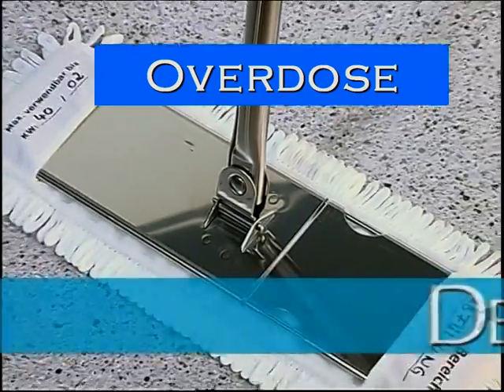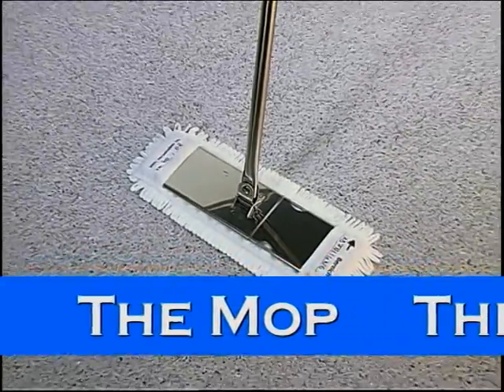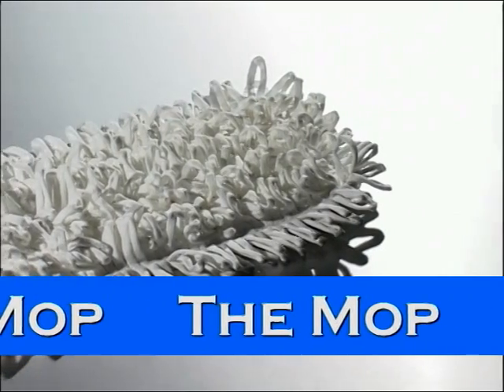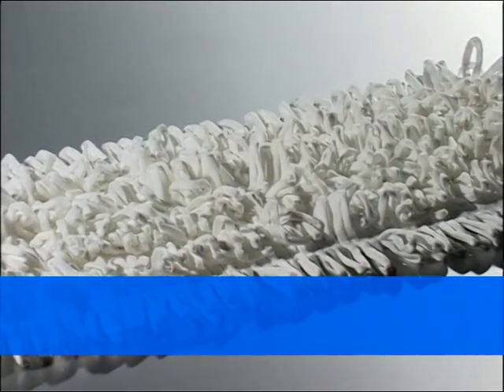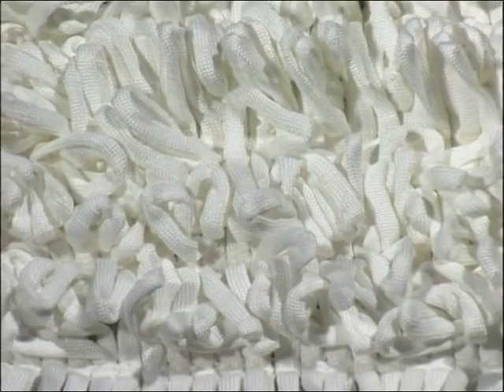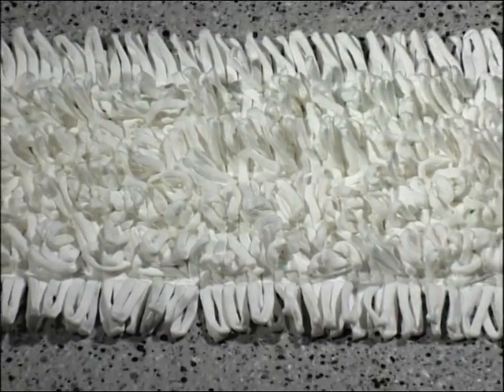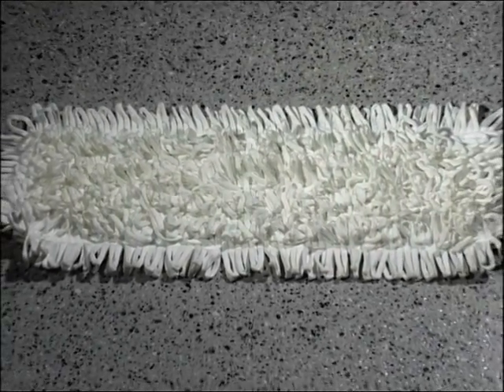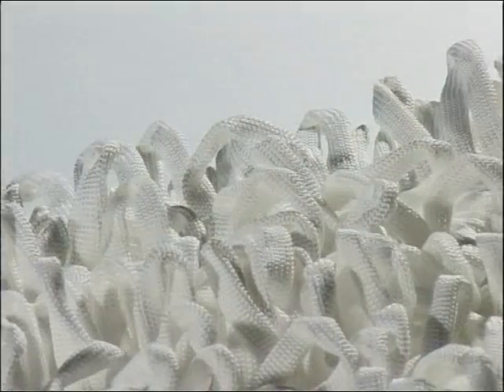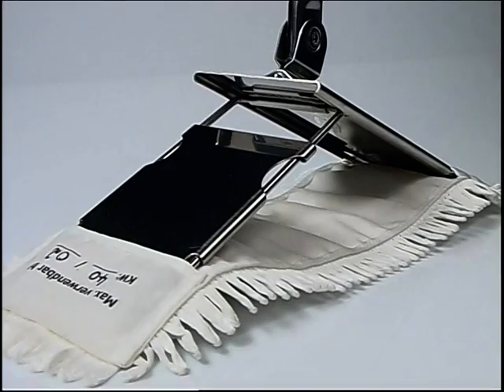Now to another important subject, because it really saves a lot of work: the mop. But it's not just any old cotton mop, it's really very special. This whole mop has been newly developed on the basis of practical experience. The mop cover is made of special microfibers that are suitable for clean rooms. It is particularly resistant and glides very easily. It is lint-free and has tremendous advantages over conventional cotton products. That's why this patented mop is the only mop that has been certified for use in clean rooms.